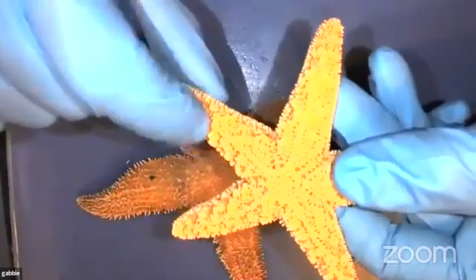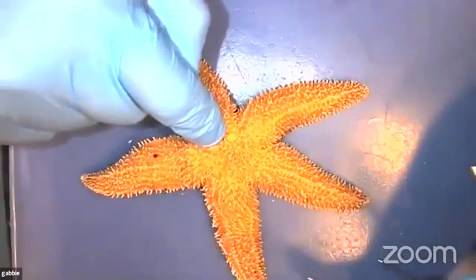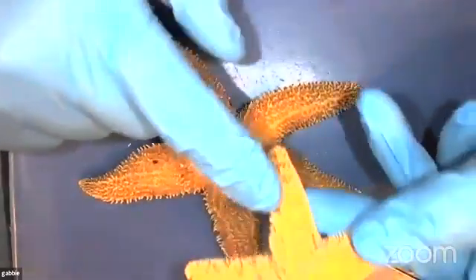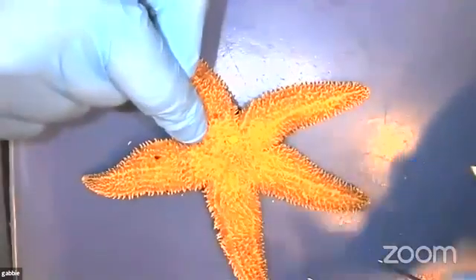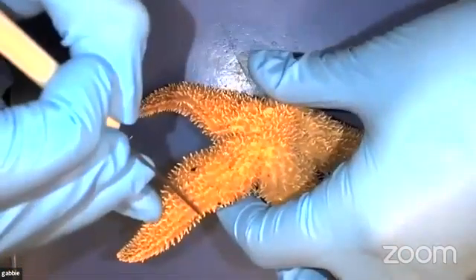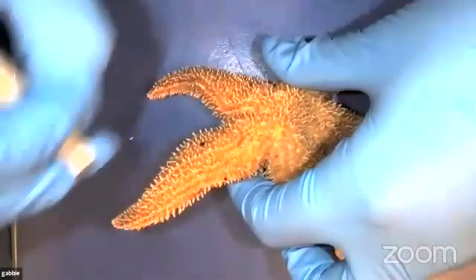So this is actually the sea star's endoskeleton. That lies right underneath the skin. They have a skin layer on top, and pieces of their endoskeleton stick out towards the outside. And these little pokies are made of something called calcium carbonate. That's what's found in a lot of other clams and shells like that. So these are the little pokes that stick out from their endoskeleton.